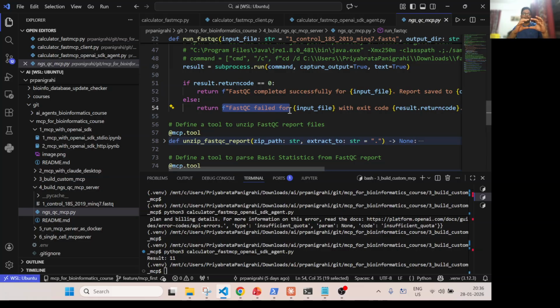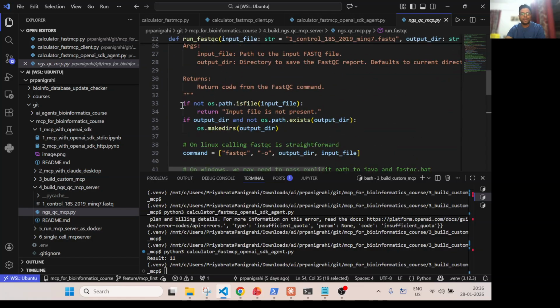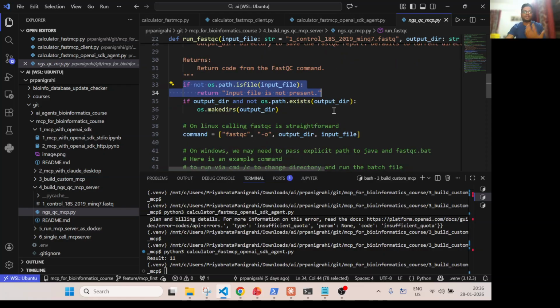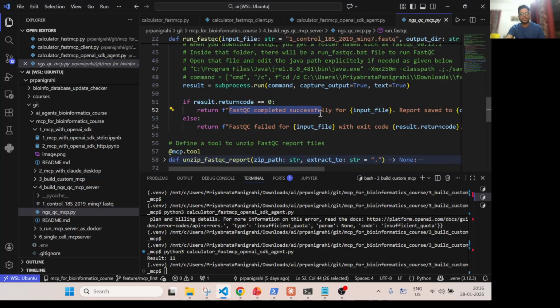This is the tool I have defined. So now whenever the agent interacts, it will first come over here. If the input file is not present, we are sending a response to the agent saying, hey, the input file is not present. If it ran successfully, we are sending a response that it completed successfully. Otherwise we are sending a response that it has failed.